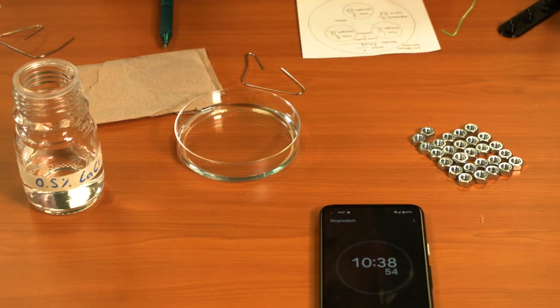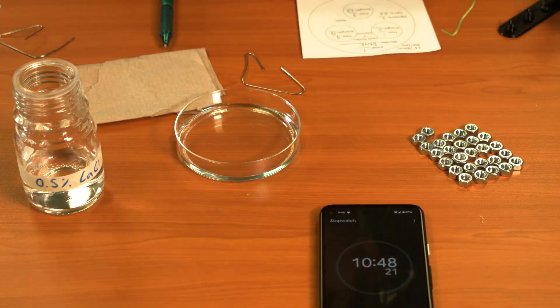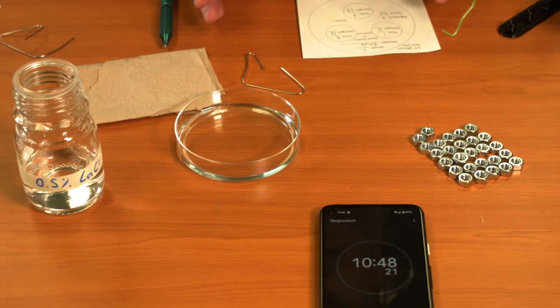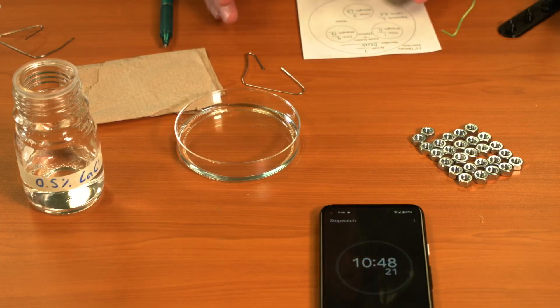You're not going to get a perfectly repeatable result for this every single time, mostly because you're not going to draw perfect rings. You're going to have some defects in some of your rings as you go through this. So if you get one that breaks early, don't worry about it.